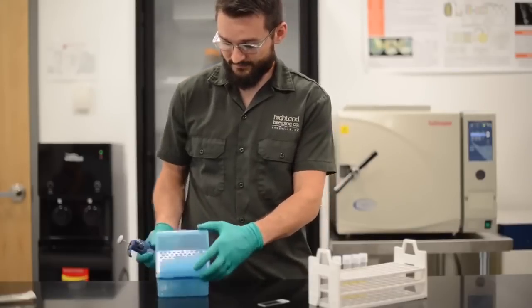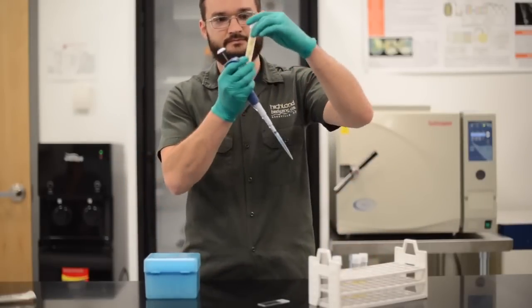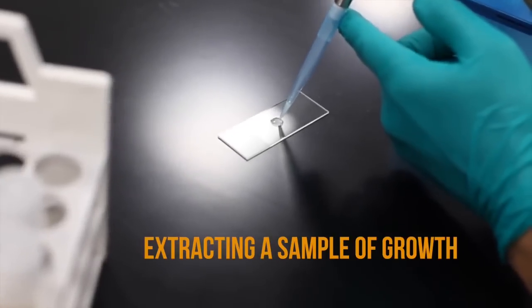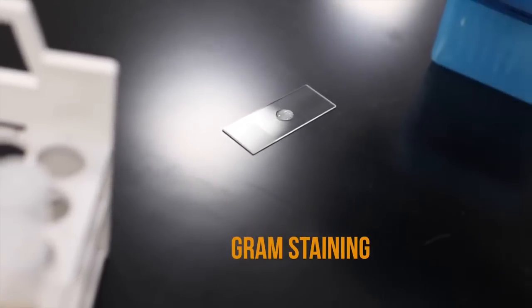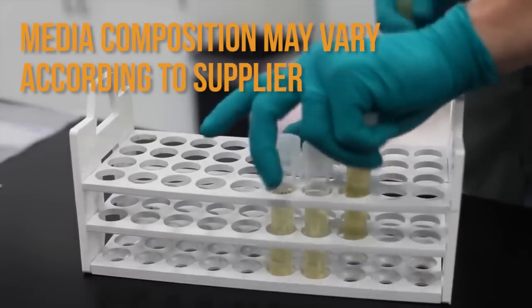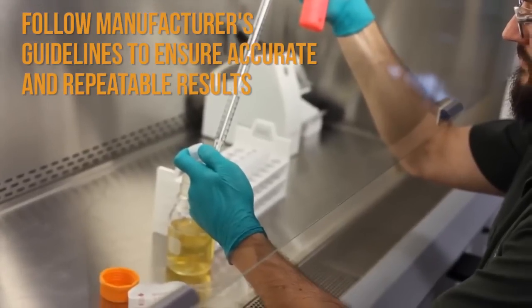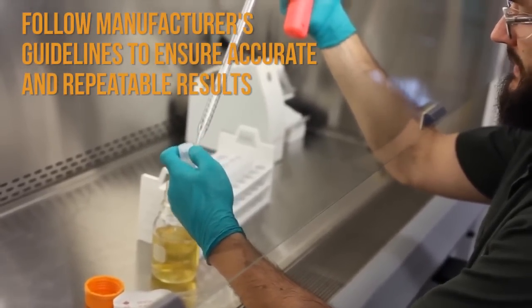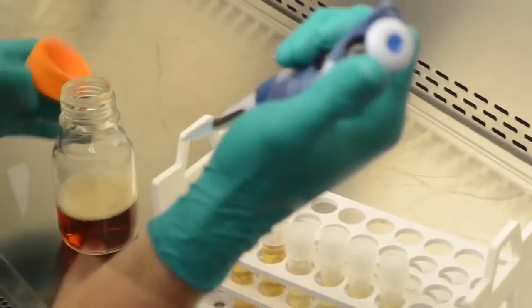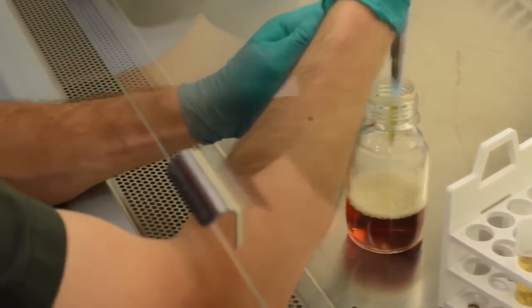It is important not to simply look at the colony morphology and assume you know what organism you are dealing with. Find out. Validate or invalidate your assumptions by extracting a sample of the growth, gram staining it, and observing its cell morphology under the microscope. At Highland, we use 15 milliliter reusable glass culture tubes with an airtight closure. We inoculate 10 milliliters of HLP media per tube with 1 milliliter of beer sample. We mix the tube and we incubate for 5 to 7 days. After interpreting the tubes, we clean, sterilize, and reuse them.